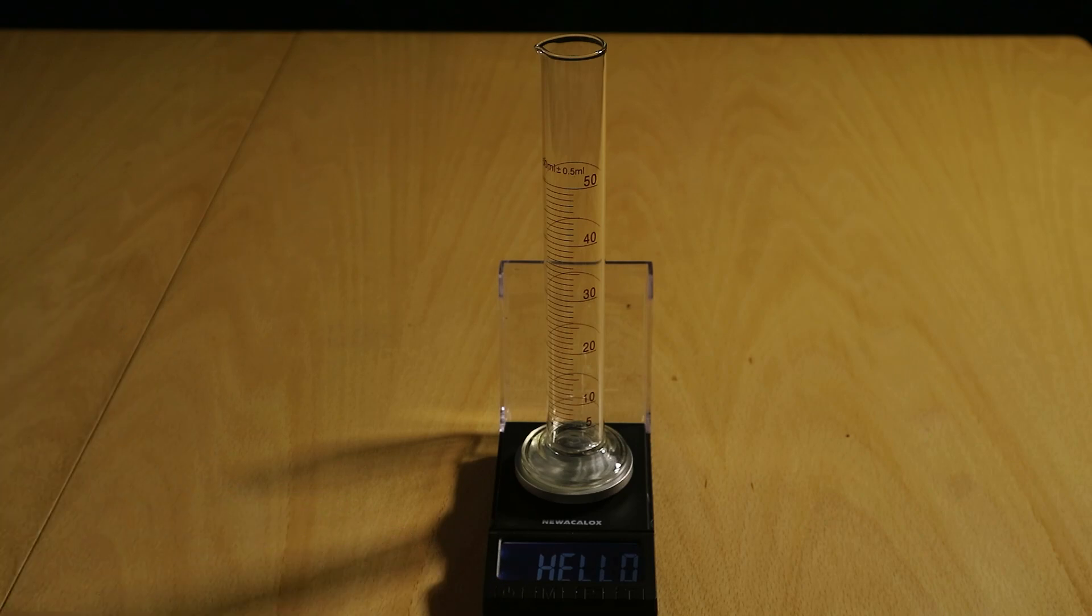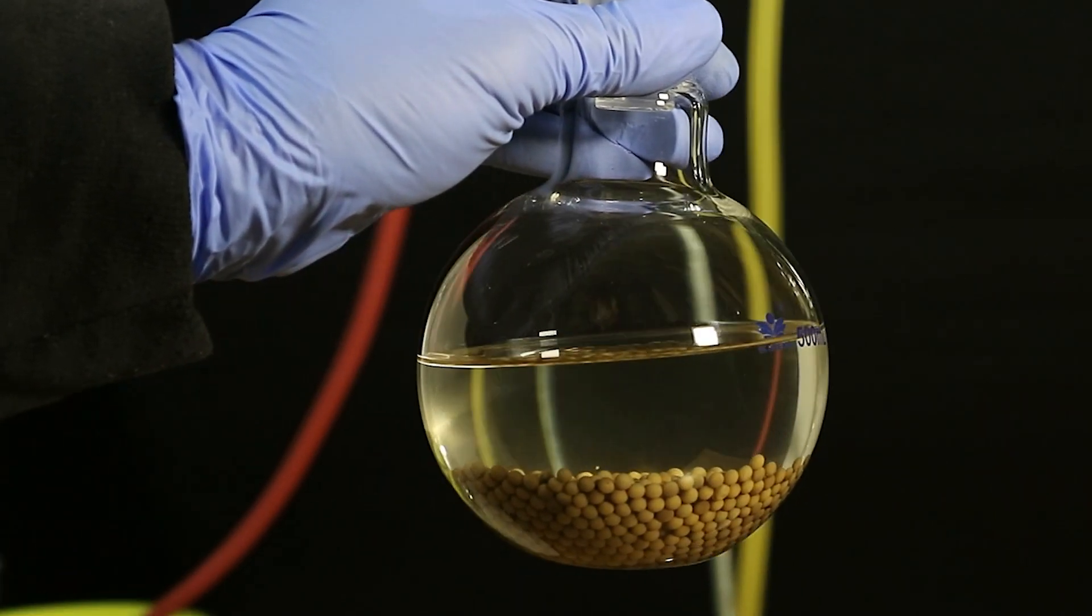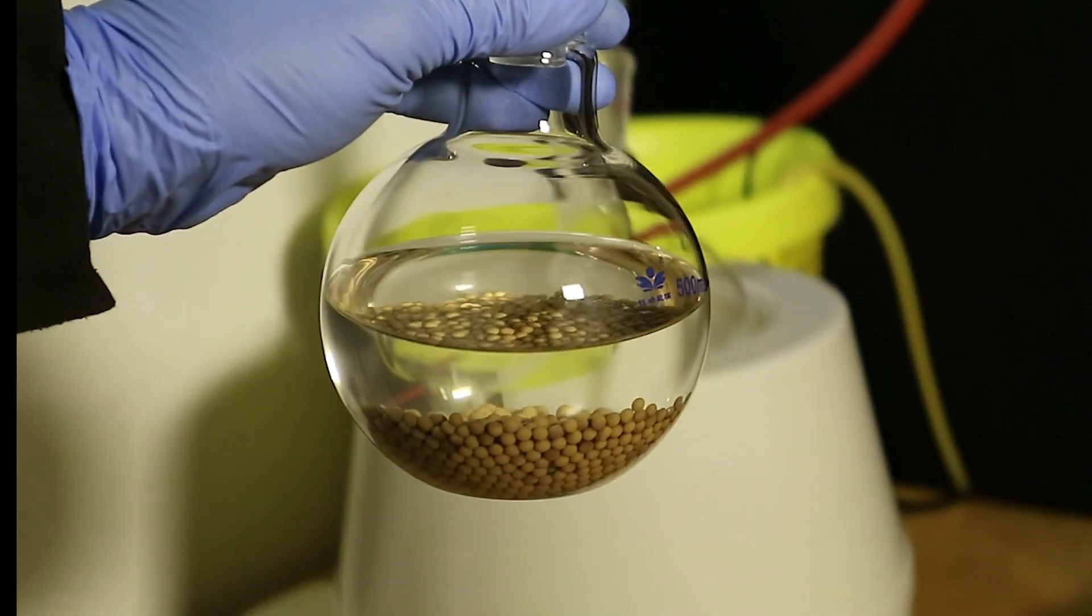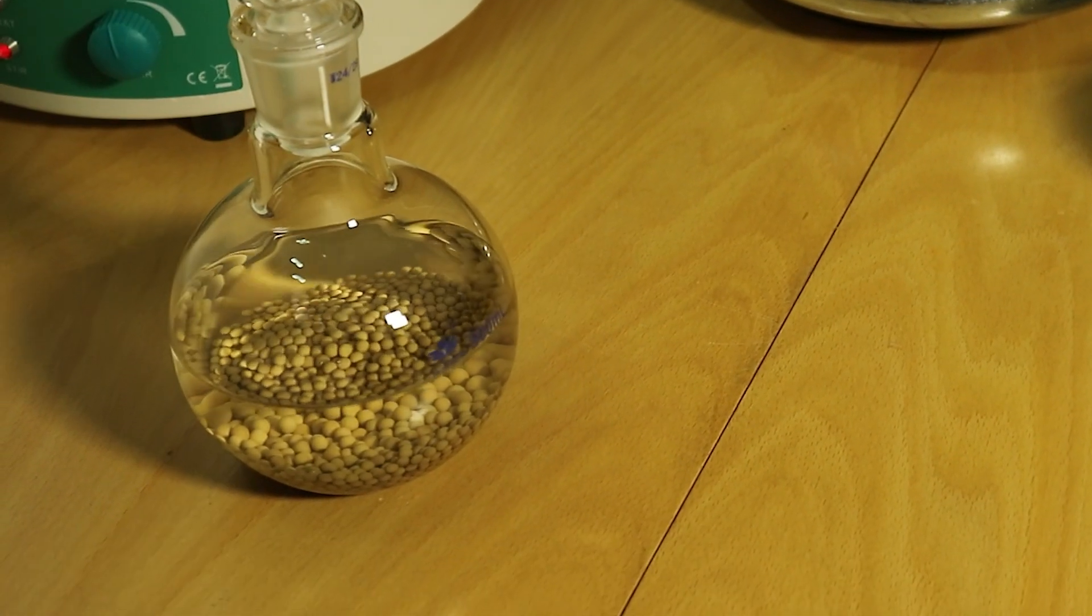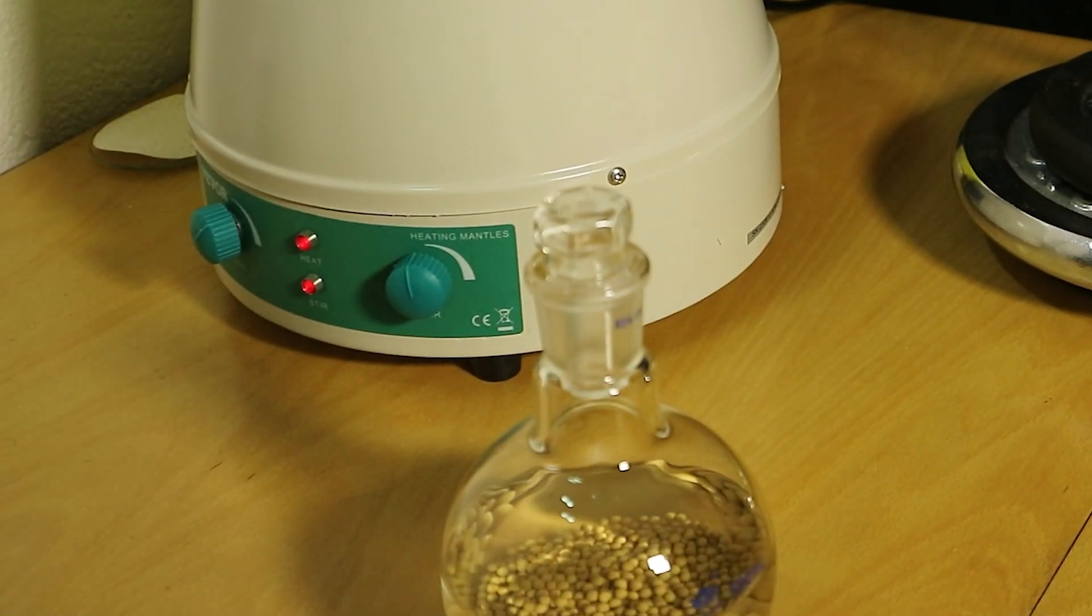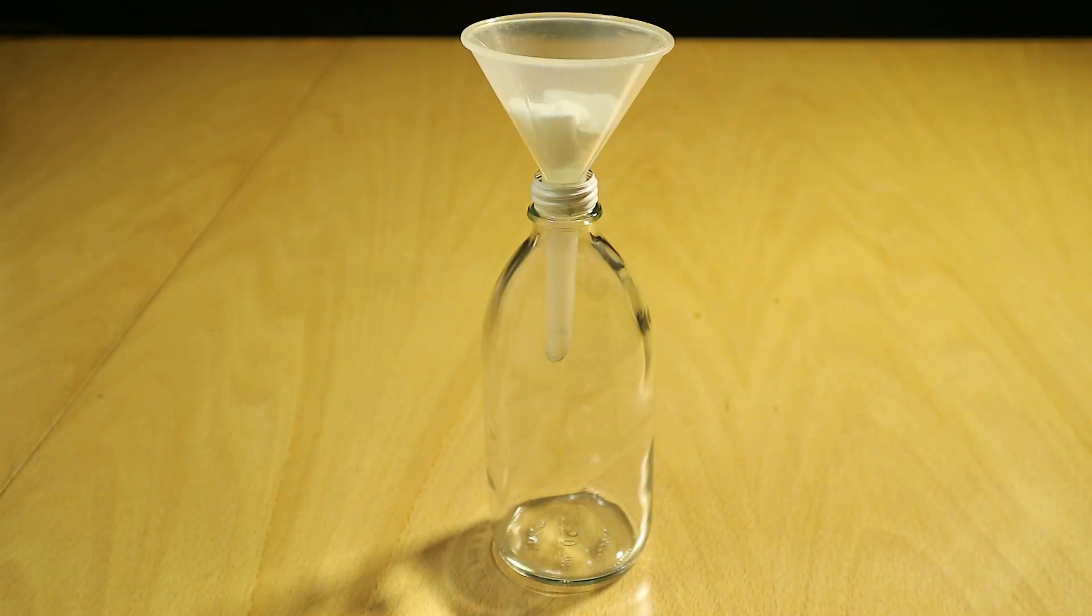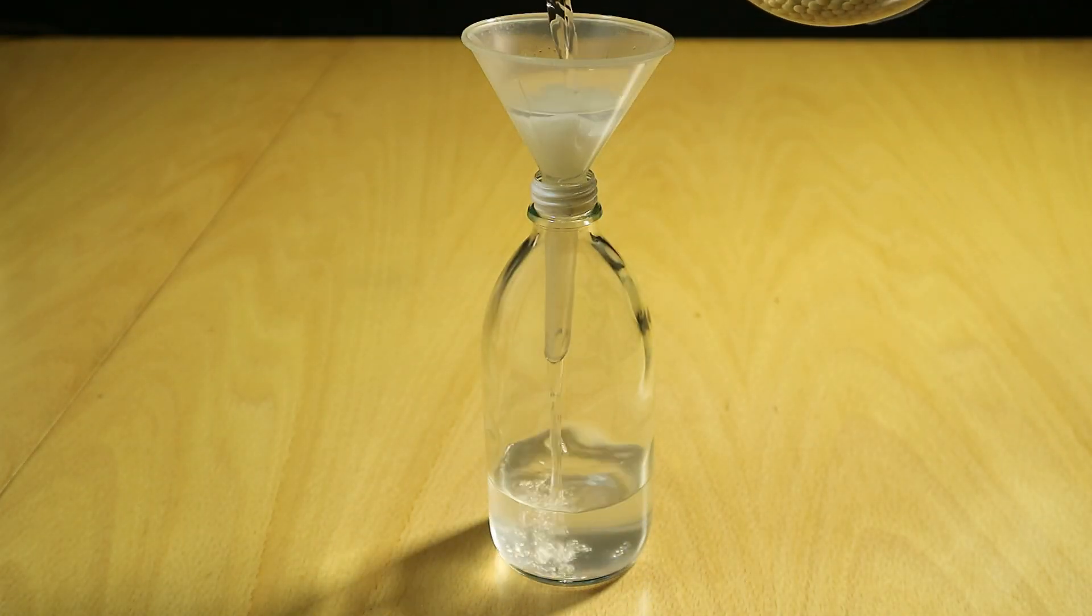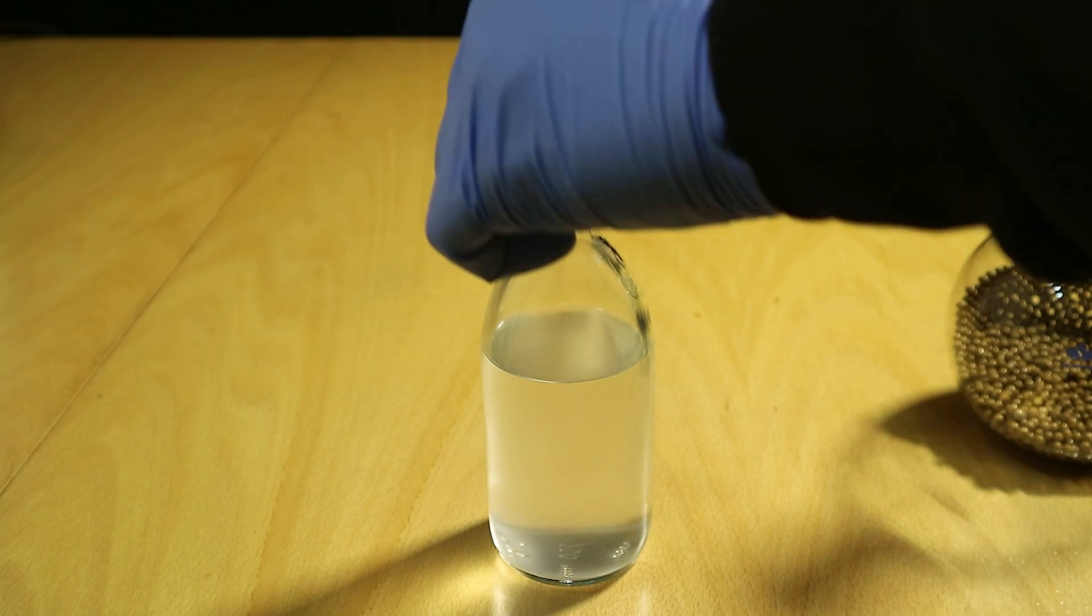Anyway let's do the last measurement I guess. At this point same as actually any time before that I let the molecular sieves actually do their work because it takes time for the water to be absorbed by them. But also this time I left the bottle to just stay for like two or three days. I was really hoping that the whole of the dust would settle.